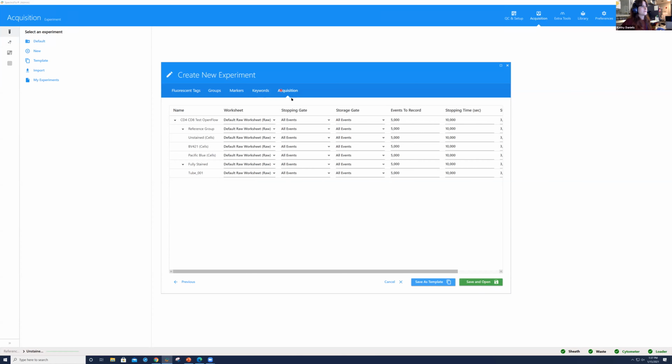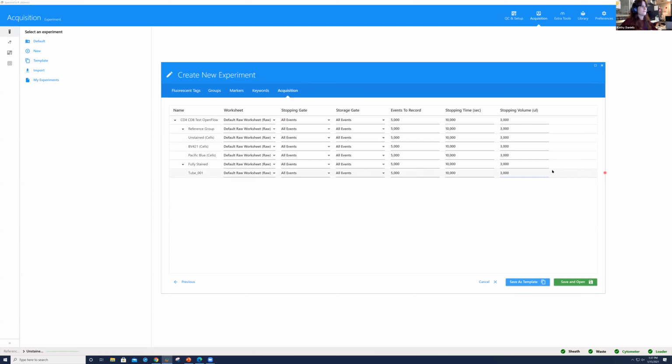And here in our acquisition tab, we see the ability to set a stopping gate, a storage gate, how many events we want to record, and so on. I'm going to make sure that I record a minimum number of events from our raw worksheet. What I like to do typically is make sure I have a certain number of events recorded by scatter. I know in our raw worksheet that P1 is equivalent to a debris exclusion or a scatter gate, so I'm going to select P1 here.